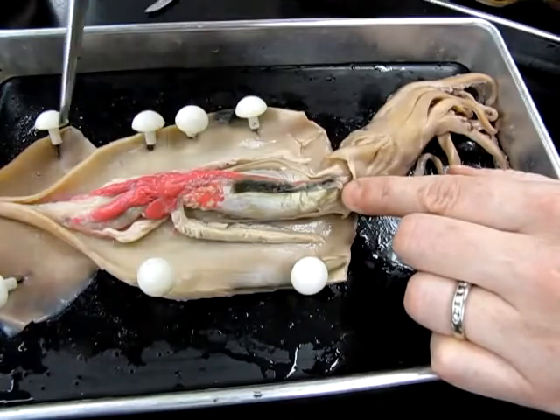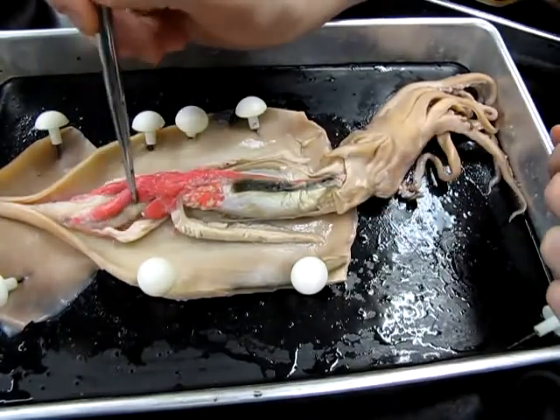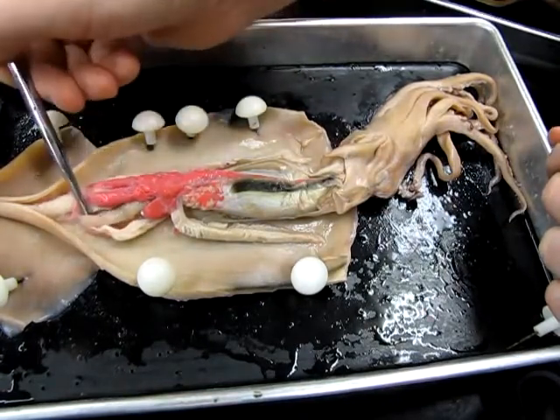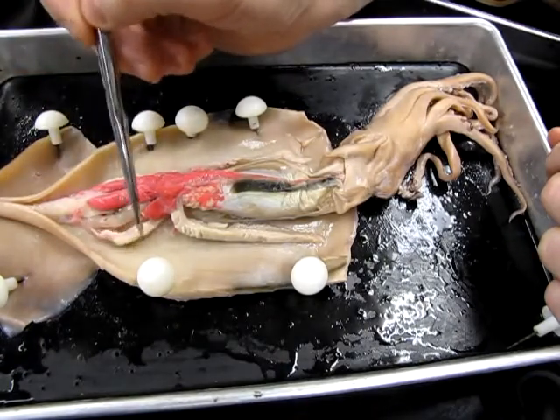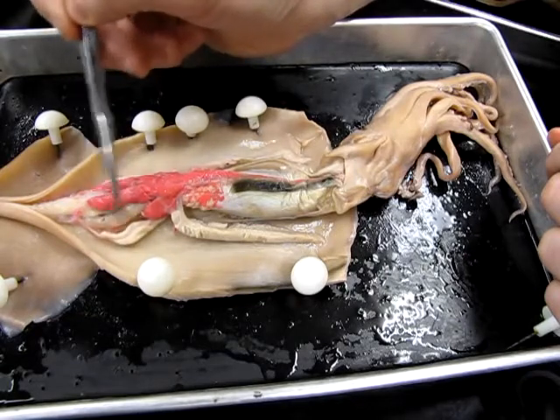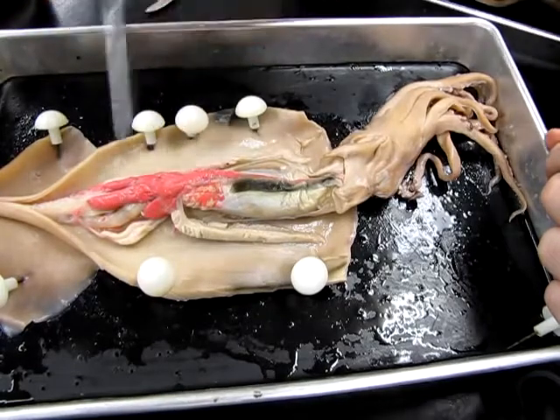All right, now this is a male, as I said, so we'll have a quick look at the male anatomy. Right here there's a clear finger-like structure. That is the male testis. That's the site of sperm production. Beside it is the vas deferens. It's all coiled up in the peritoneum there, but there's a long loopy coil of vas deferens, and that's where the sperm passes through.